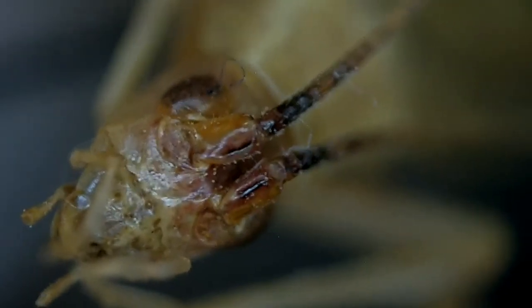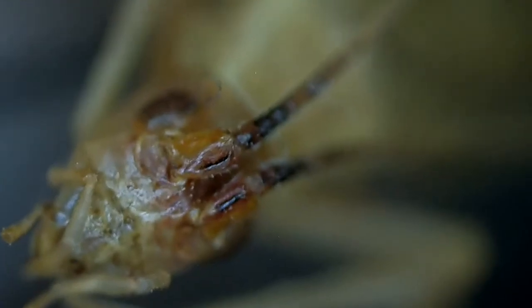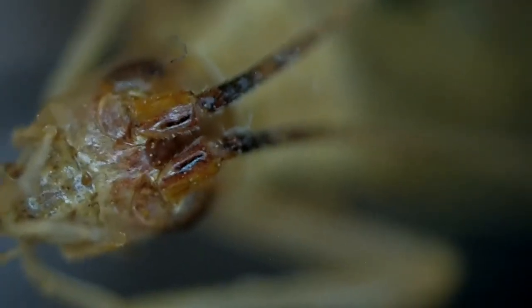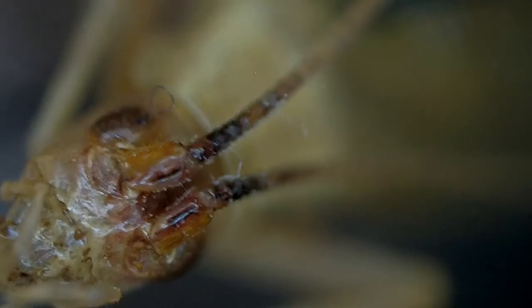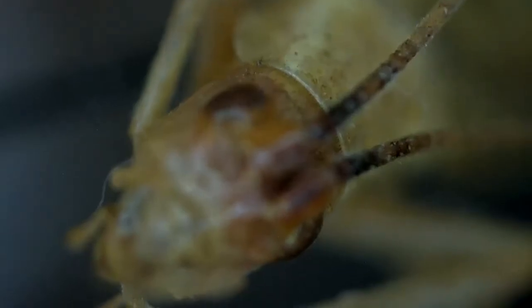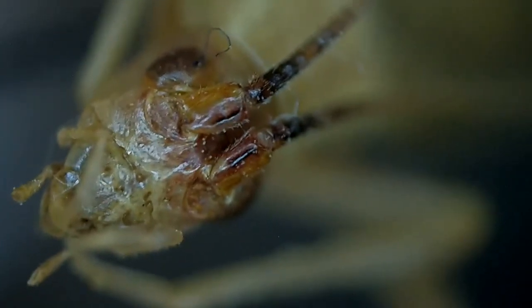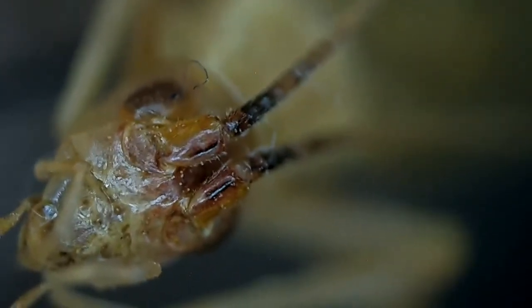I'll also show you the Californicus one. It's kind of hard to see, but there is a line there. This one is from Colorado. So this was just a quick video on how I went through and identified the Oecanthus tree crickets.